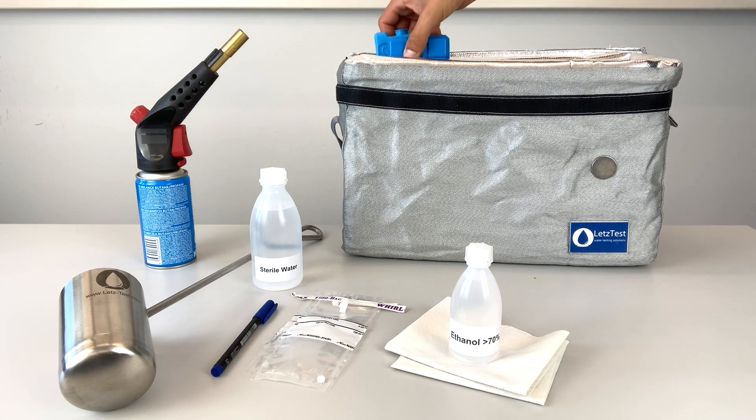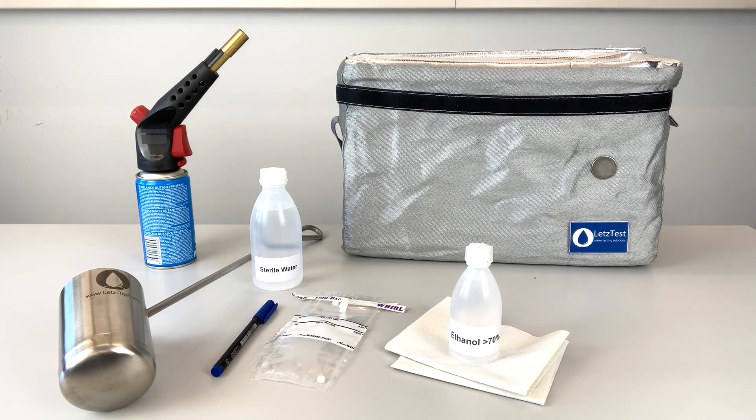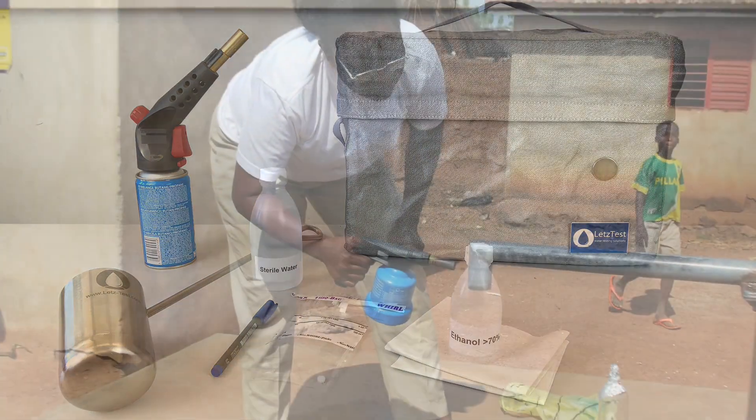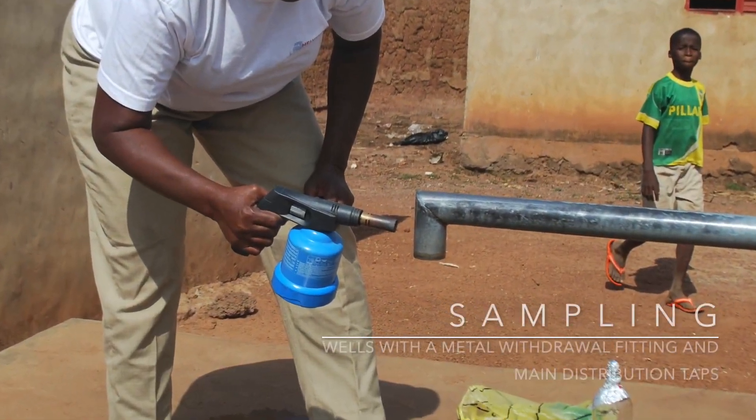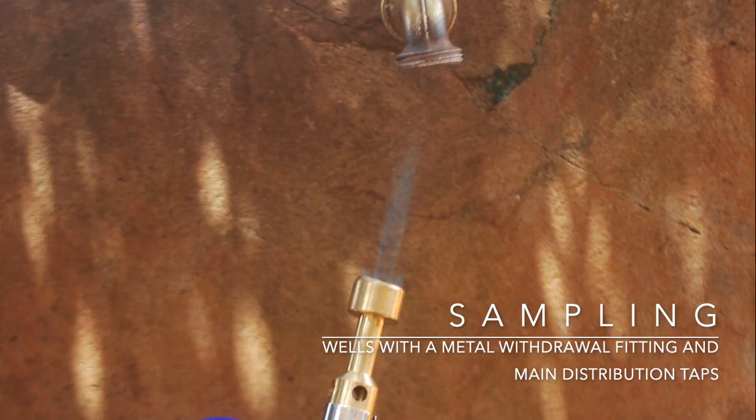Bring an icebox if you are not testing the samples immediately to chill them on the way back to your water laboratory. Here's a tip: you can use the empty electricity-free incubator, add cold packs, and use it as an icebox.